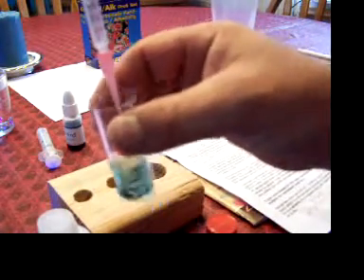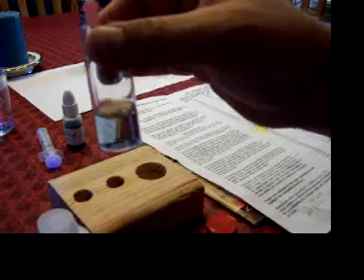Adding it to the solution, and then we'll read what's left in this syringe, and we'll cross-reference it with that chart on the paper. And what we're looking for is a color change. I'm slowly pushing down on the syringe. I'm slowly adding and shaking at the same time. Now we're going to get close to the color change right now. I've seen it. I don't know if you can see it, but it's starting to change. And that was it. It changed from blue to a pink, pinkish red. Okay. It changed from blue to pink.